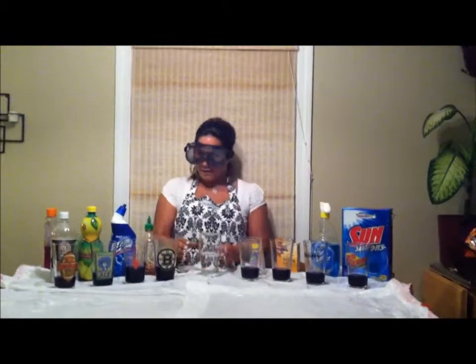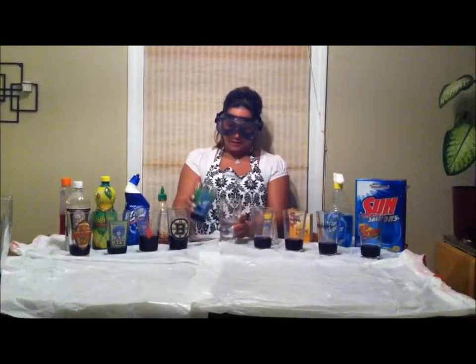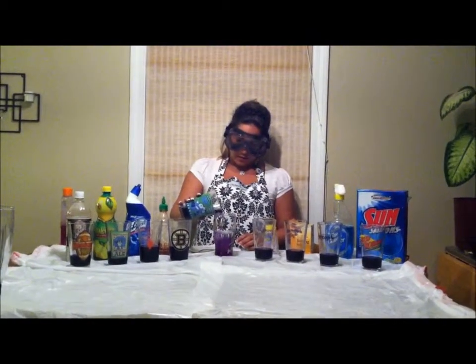So here we have water. And we're going to add a little bit. Just to show you, this is our control. And we'll start with the bases first.